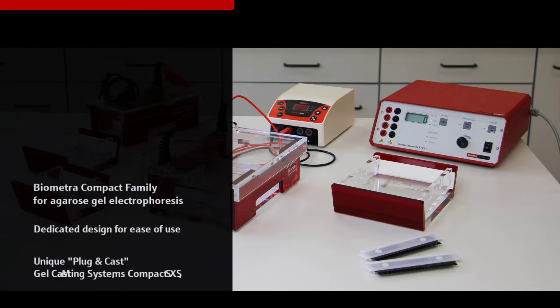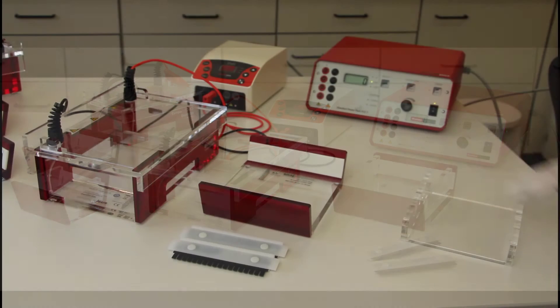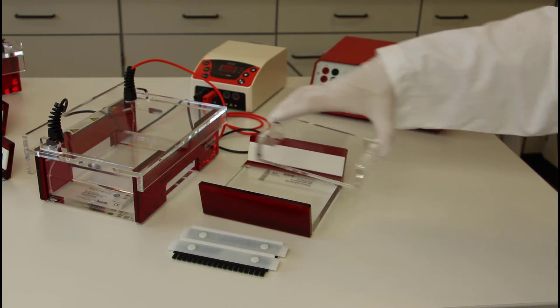The plug and cast casting systems allow safe casting of gels in seconds. Leak-proof casting of gels has never been easier.